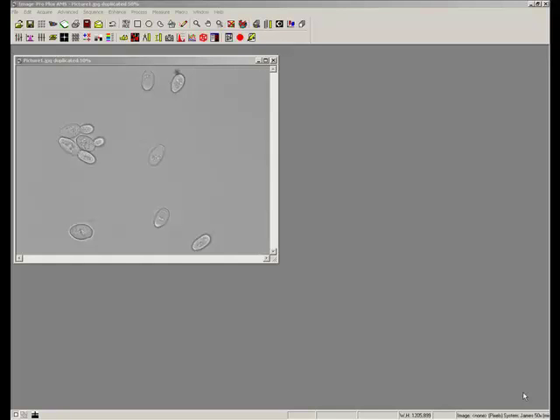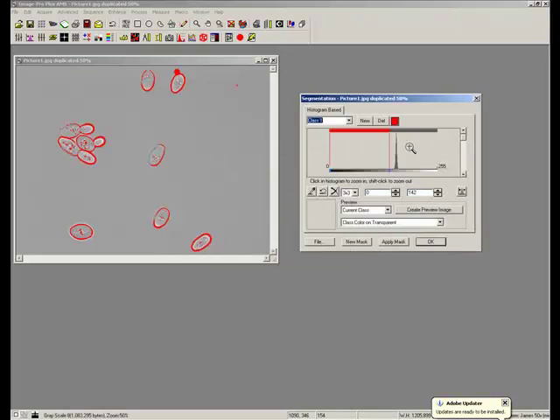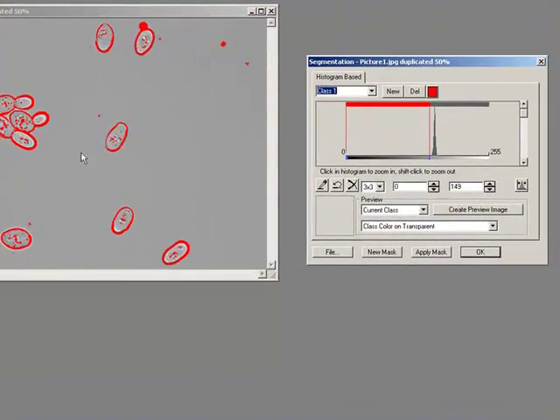This is a quick movie just showing you how to analyze images from phase microscopy. These are typically quite difficult to analyze because of the edges and the illumination techniques. So what we're going to quickly look at is, well, what if I treated this like a dark object thing? Well, look, I have all of these problems because I'm not able to threshold the inside. I'm only able to threshold, in this case, the outside.